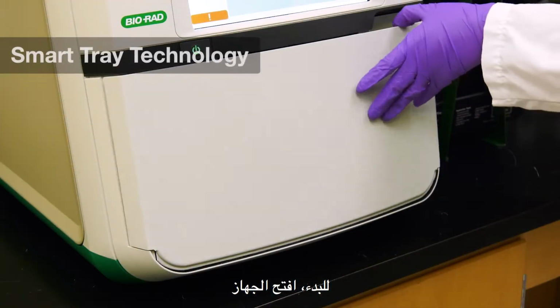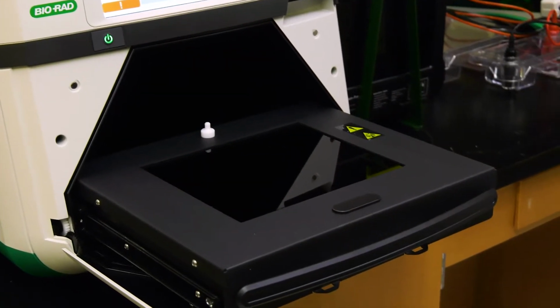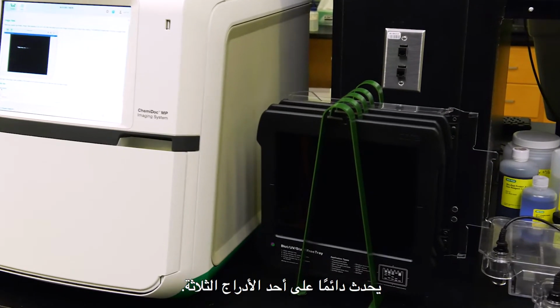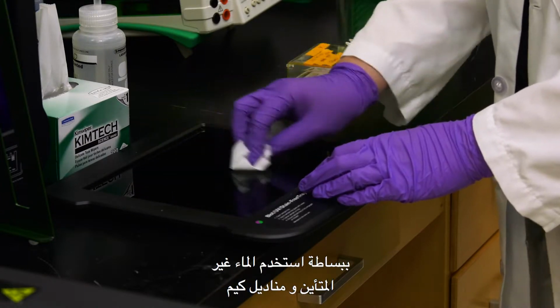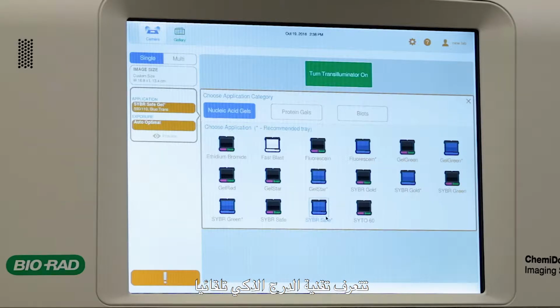To begin, open the imager and pull out the transilluminator. Remember that all gels and blots are always imaged on one of 3 trays. It is easy but important to clean the trays. Simply use DI water and a Kim wipe for the best performance. Smart Tray technology automatically recognizes application-specific trays and adjusts imaging parameters and software options accordingly.